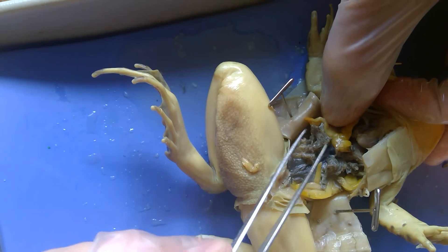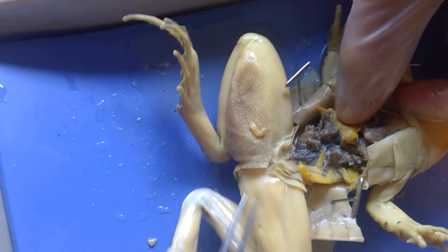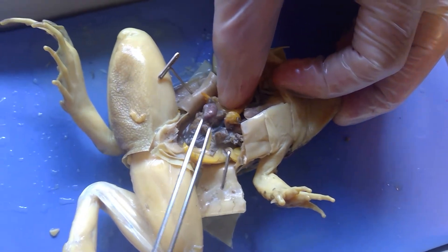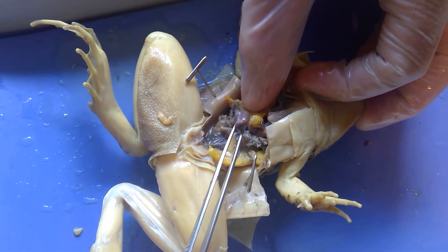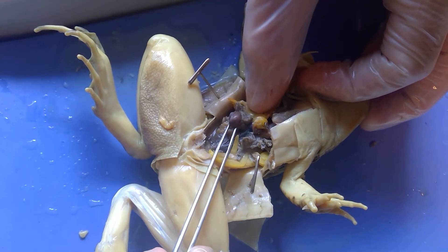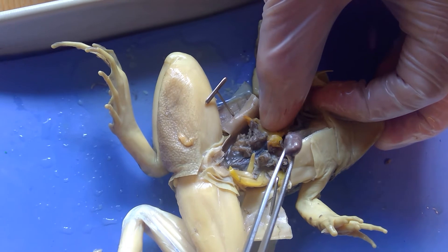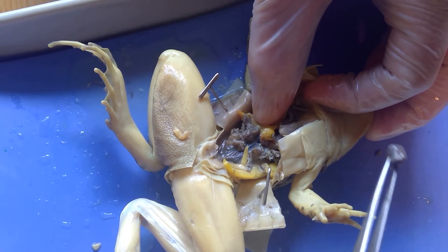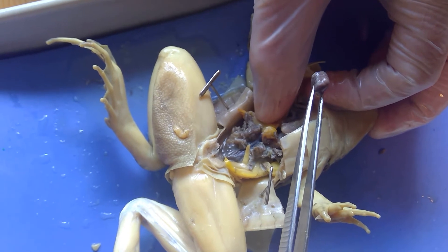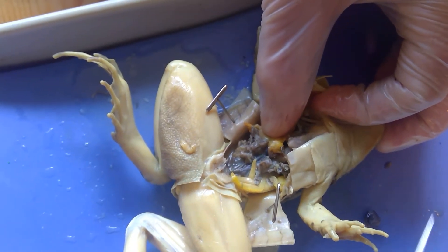If you could see the ovary of a human or the ovary of a pig, you would see they were much, much smaller. The spleen I just removed is about the size of a human ovary. Compared to this frog's body, a human ovary is still pretty small. The reason your ovary is small is because you're laying one egg at a time.